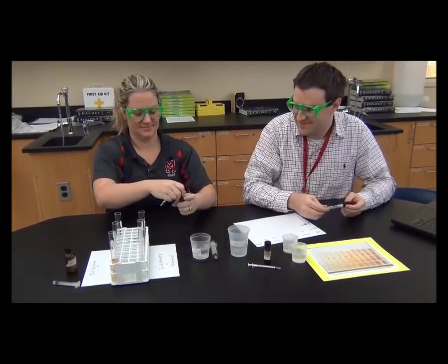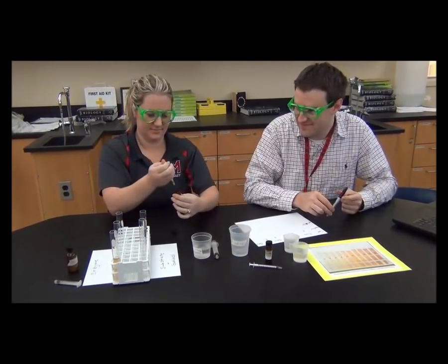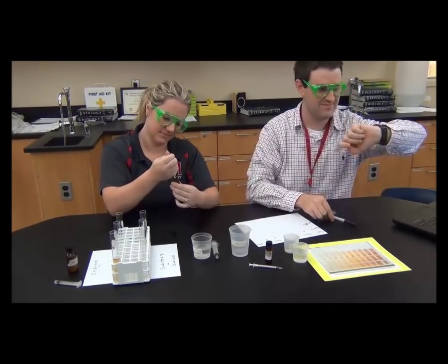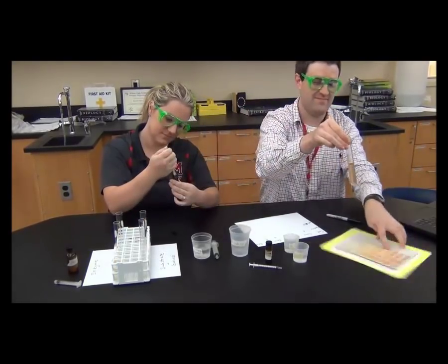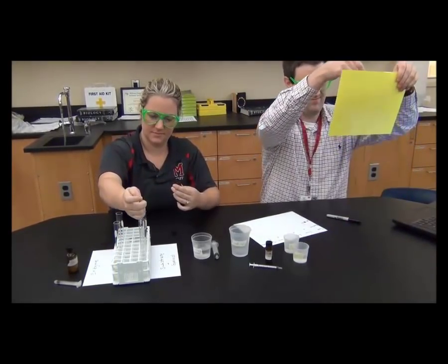You can always team up. One person adds the correct chemicals to the next set of test tubes while the other takes a reading every minute, so you can split the work between you.